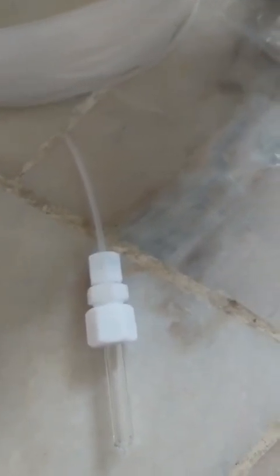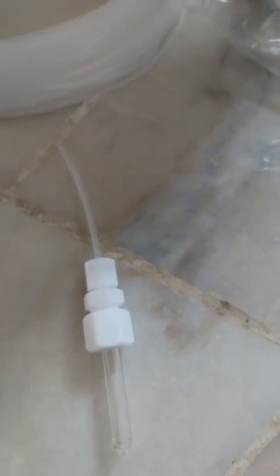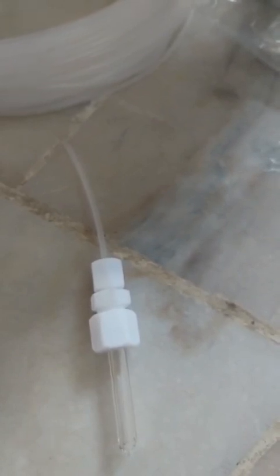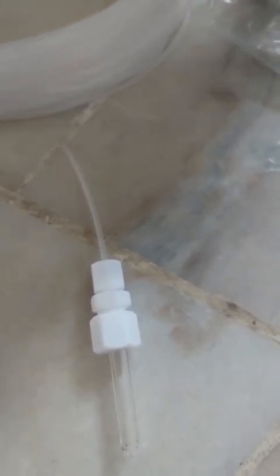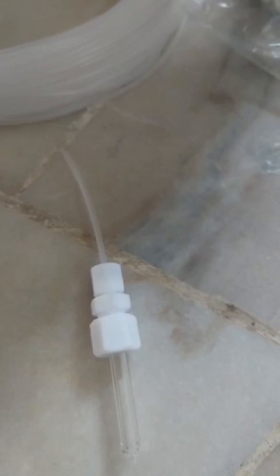But when your system is based on pressure control, that means you have a pressure controlled device and you need the pressure inside the system to be maintained at a predetermined value. At this moment, you can give the pressure at the regulator side about 10 to 20% higher than your requirement.